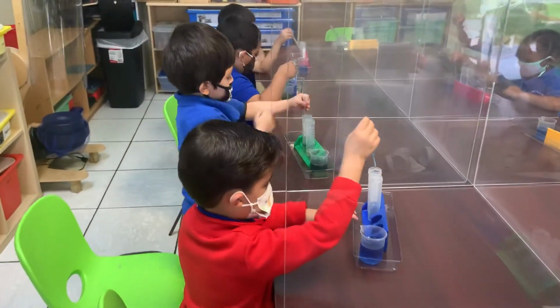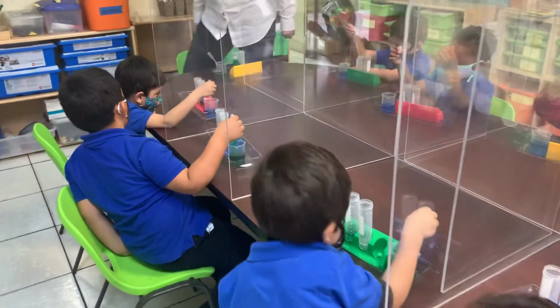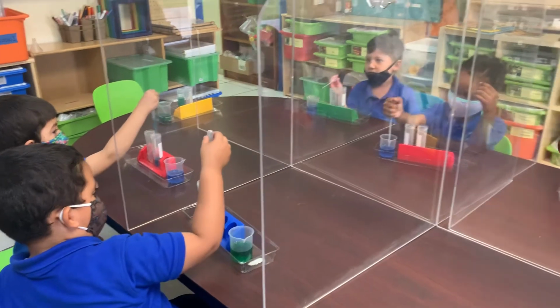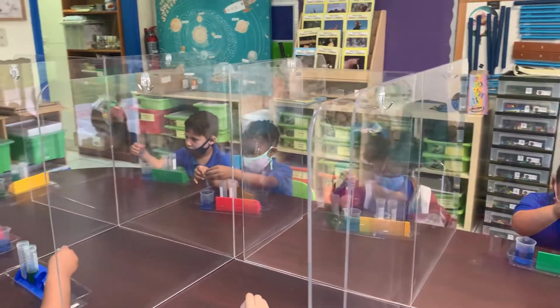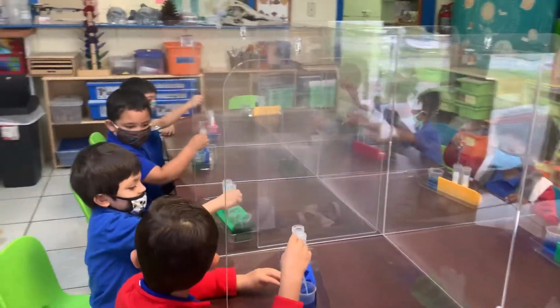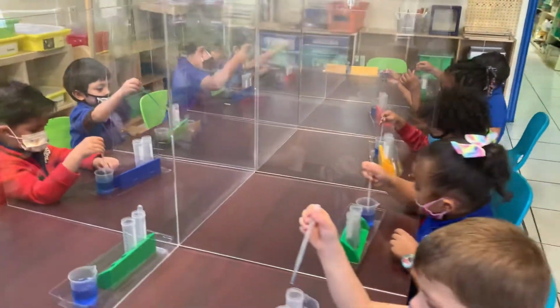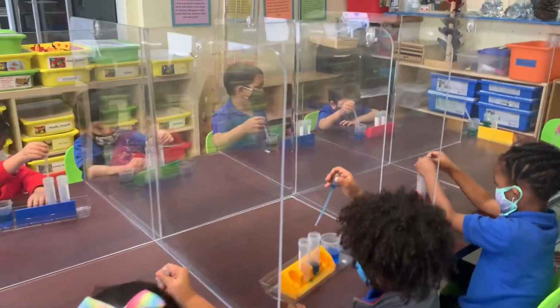A 3 and 5. What number are you at? A 10. Yeah, you're at 10. I'm at 15. Good. I'm at 5. Oh, you're at 5. Good. You're at 5 too. You guys know your numbers really well. I'm almost there. You are.